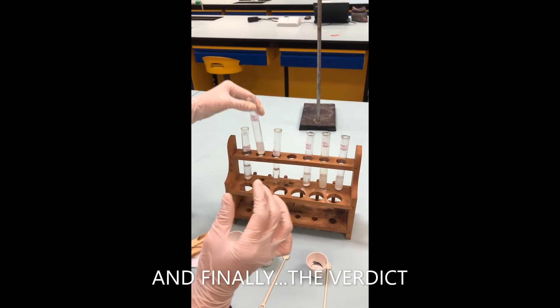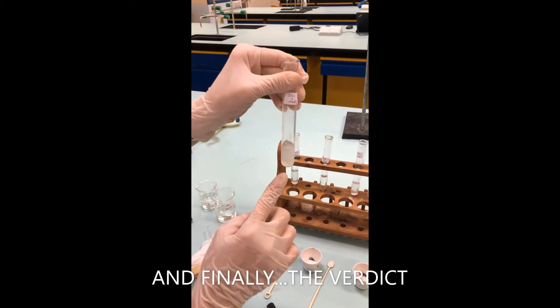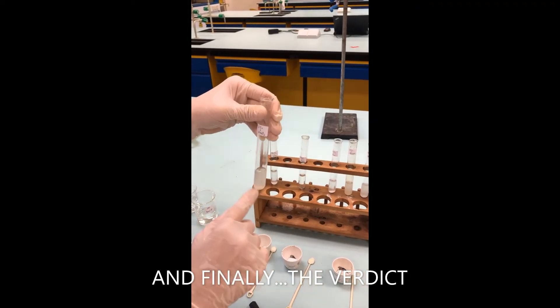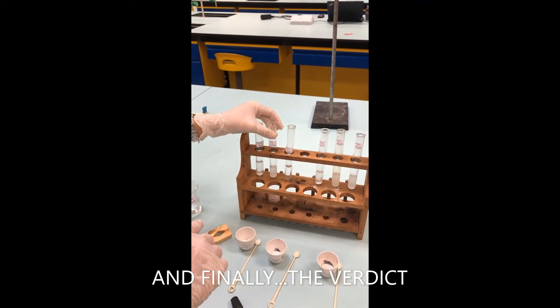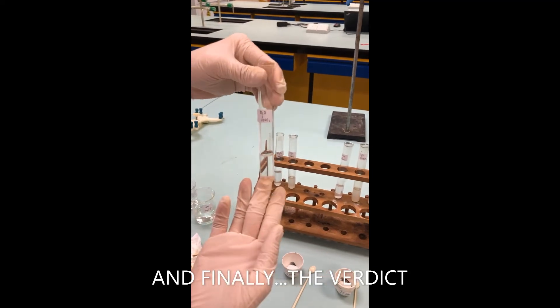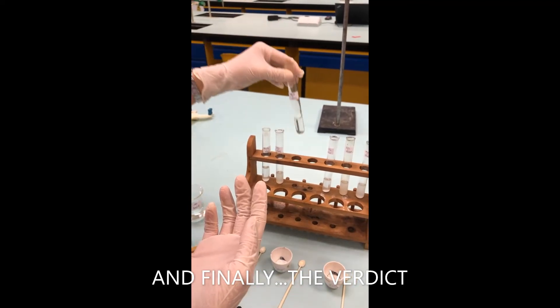You can see that silicon dioxide and nitric acid — totally no reaction. There's quite a lot of solid left and the solution is not very clear either, so this is just a mixture because they don't react. An acidic oxide and an acid — nope. On the other hand, magnesium oxide and nitric acid is our best outcome — definitely a reaction happens here; neutralisation occurs.